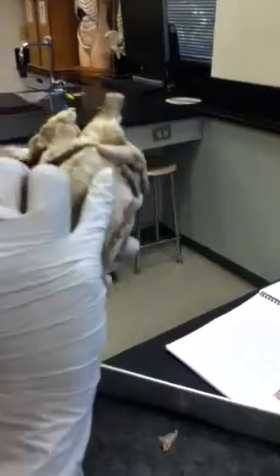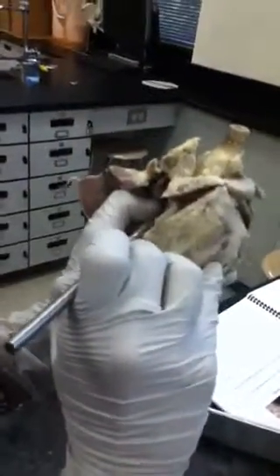All right. The other structure that you have to be able to identify is the coronary sinus orifice, which is just inferior to where the inferior vena cava comes in. Right where my probe is, right here, is where the inferior vena cava is entering into the right atrium. Right below it is the coronary sinus orifice, right here. Can you see that?